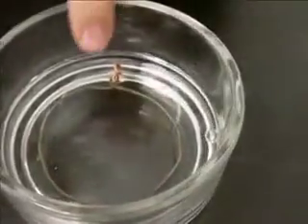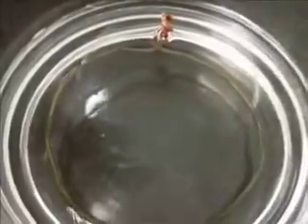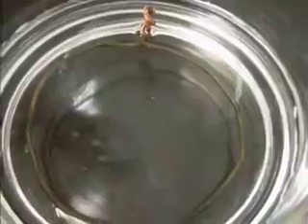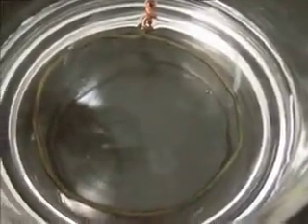Yeah, but you can start to see it's no longer that shiny copper color. It's starting to turn into kind of a darkish color. That's actually silver that's forming on the outside. What we're going to do is we're going to stop this. We're going to come back in a couple minutes. We're going to see what that looks like.